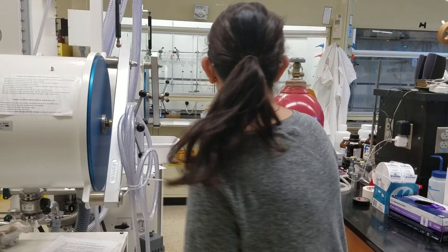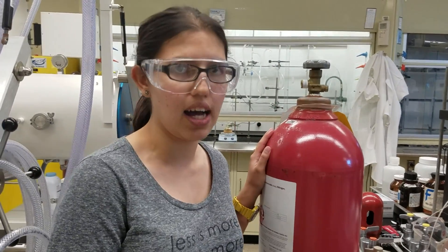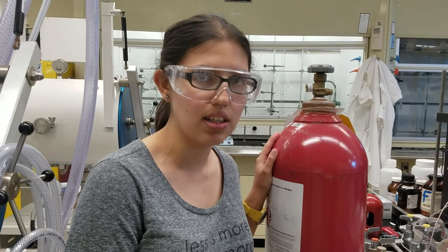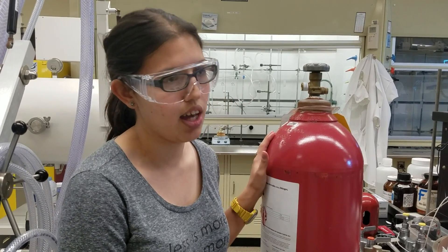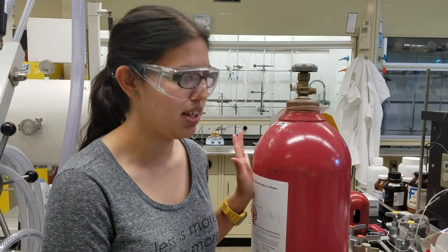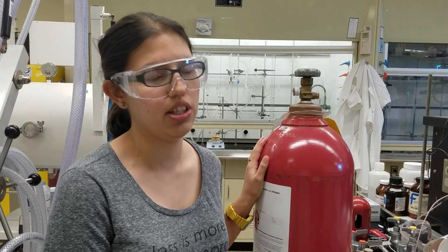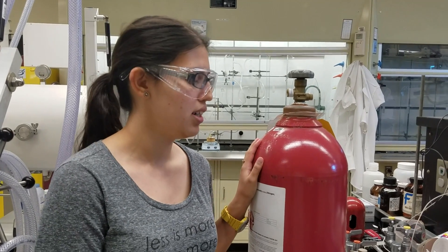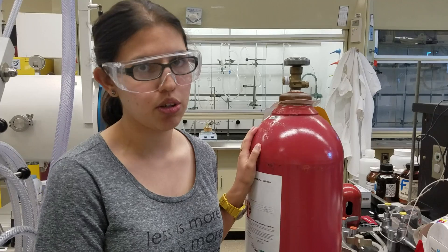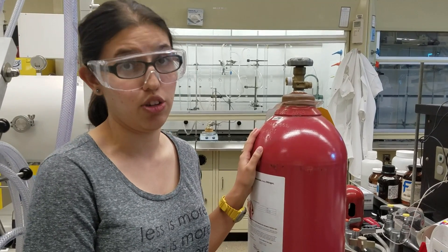So the first thing you're going to need is a 10% hydrogen, 90% nitrogen regeneration tank that you can get from the stockroom. You can download the Excel sheet and order that online from the department, it's free. So whenever you need to do regenerations, go ahead and do them.